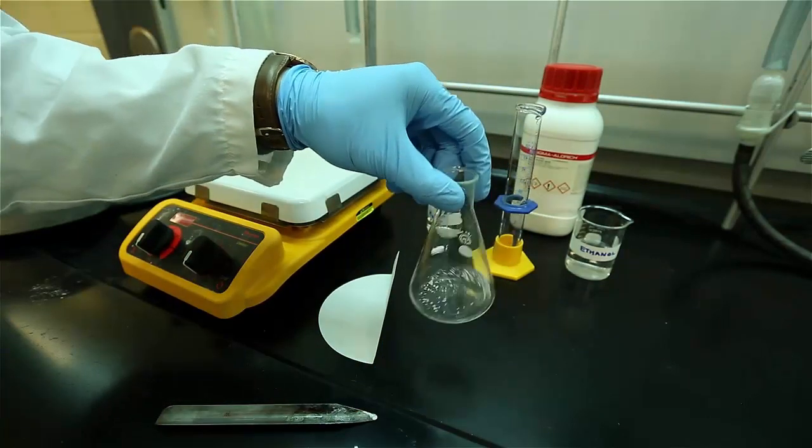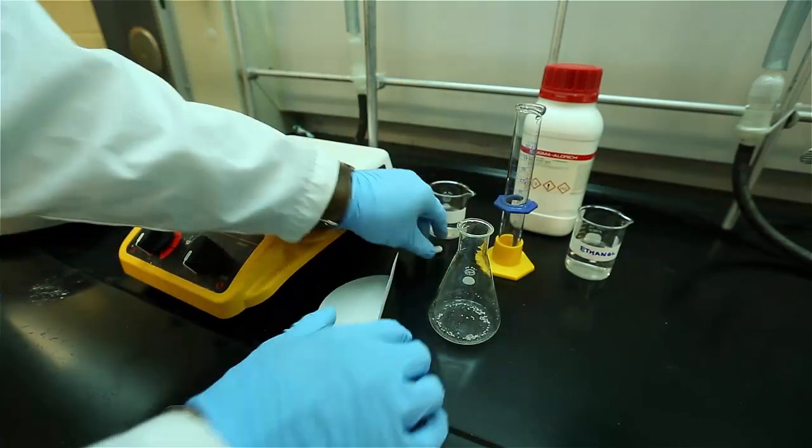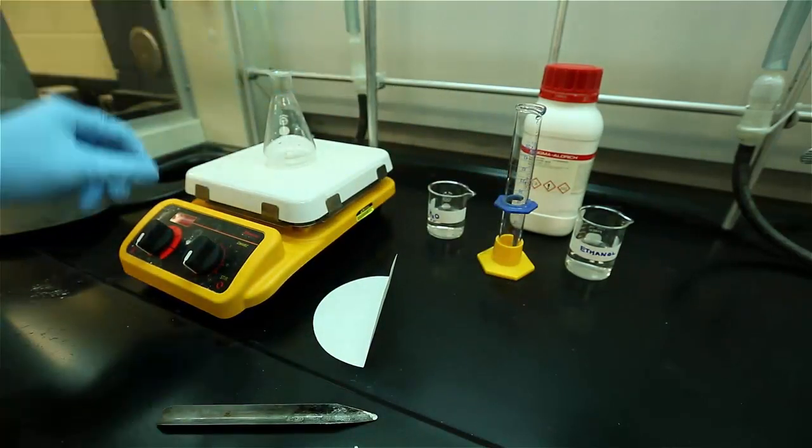Be sure to add a stir bar to avoid solvent bumping and if you forget to add the stir bar after you've heated the mixture, wait for the solution or mixture to cool before you add the stir bar.